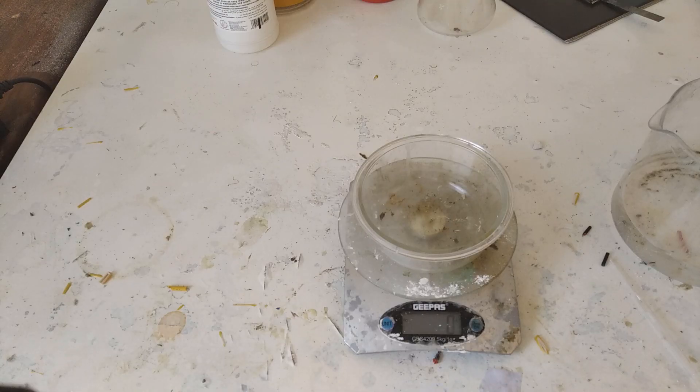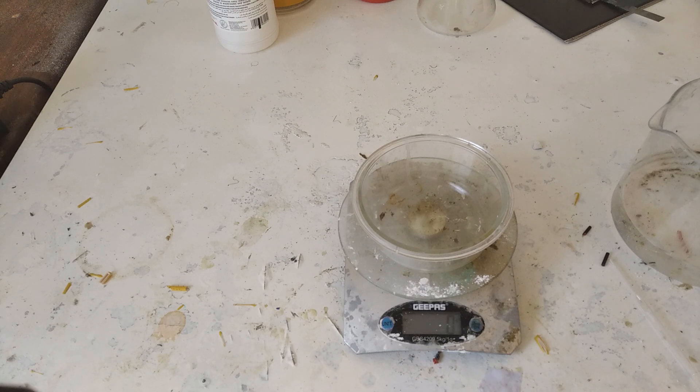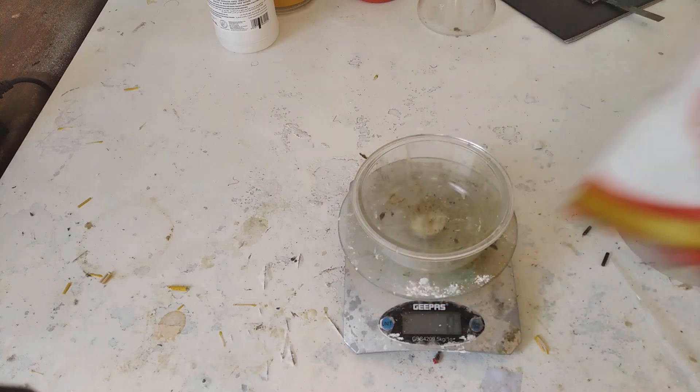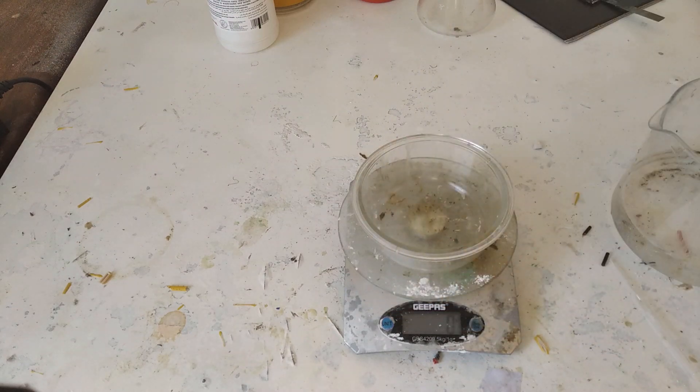Here is your voice. Today we are making anion exchange membranes. Now we need glutamic acid to make those membranes but we're only sold monosodium glutamate.